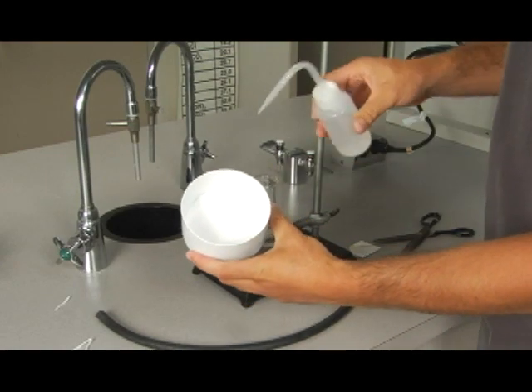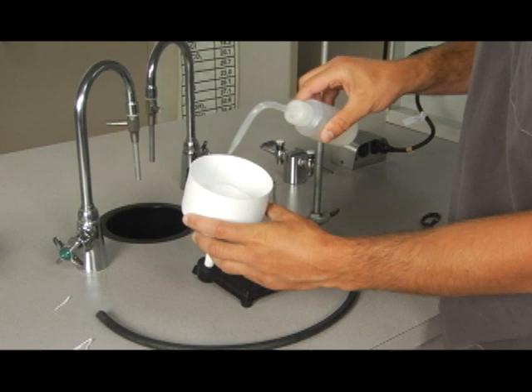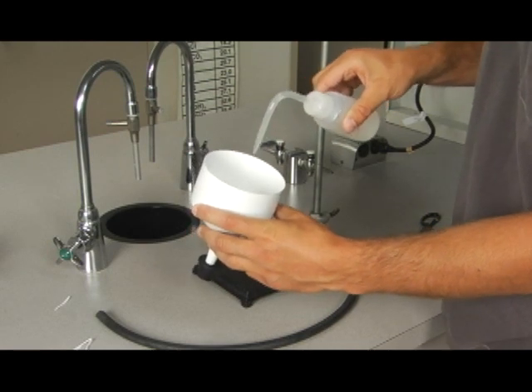An important step here is to wet the filter paper with water, deionized water. So wet the filter paper.